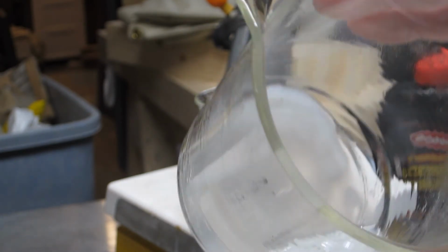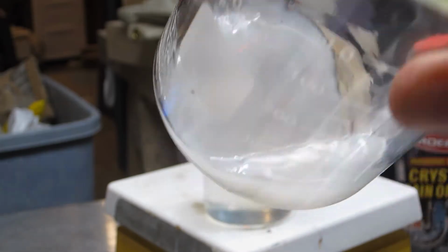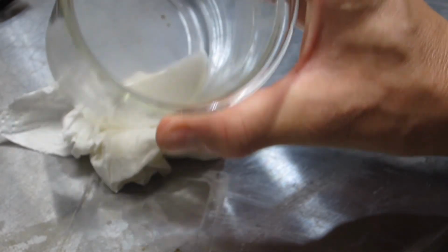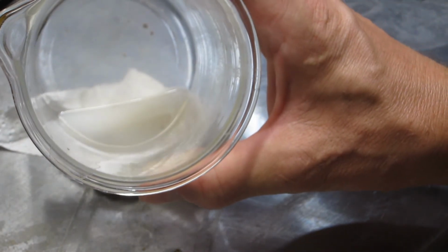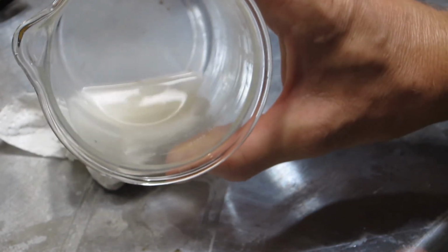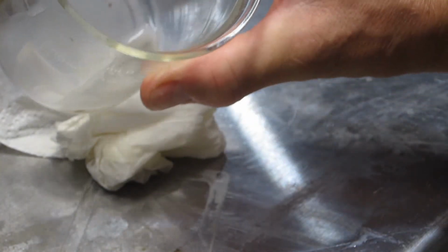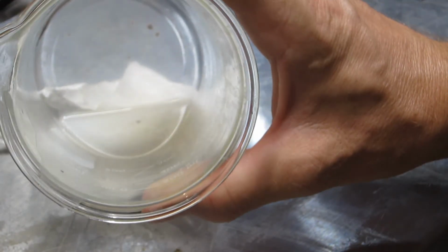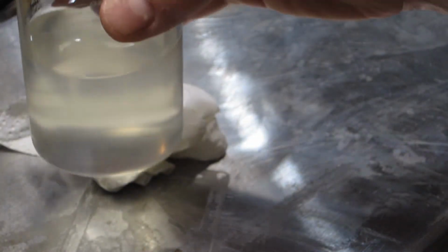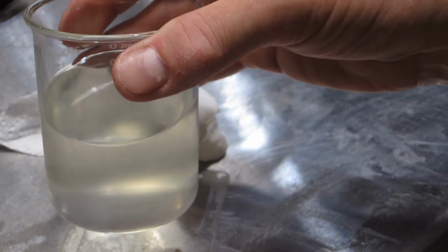So now what in the world is that? My bet is it's filler. What they're putting in those sachets is just not pure silica gel. It's got something else in it, and that something else is there. Just a guess. But in any case, now you're probably asking yourself, why bother?